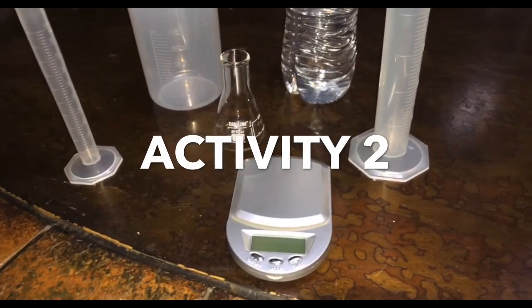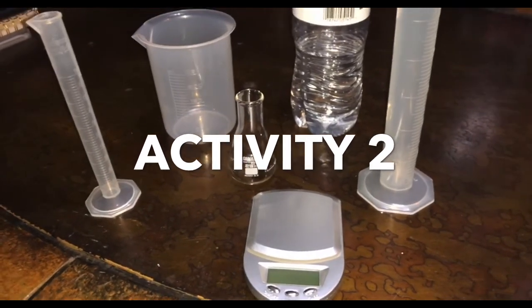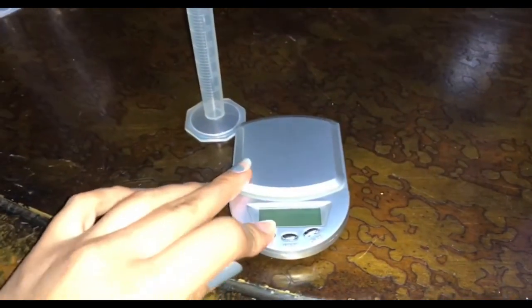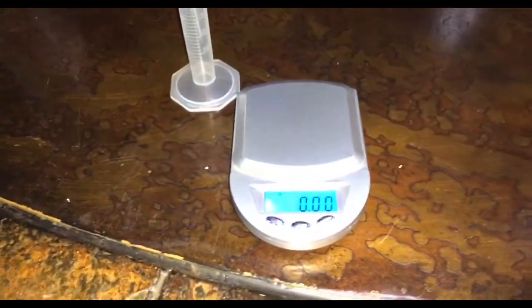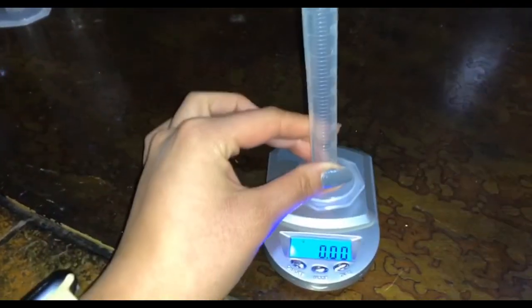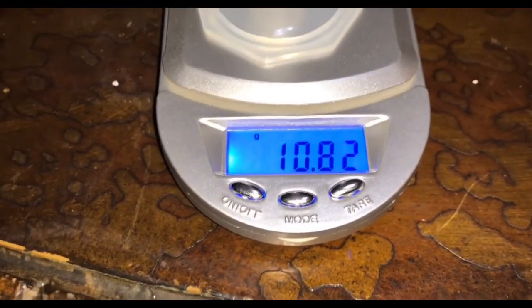Now for activity 2, we do need our balance, our 2 graduated cylinders, water, our flask, and our beaker. So for our first step, we need to turn on our balance, stabilize again at 0.00, and put on our 10 milliliter graduated cylinder and record that mass again in grams on our table provided in our lab manual.